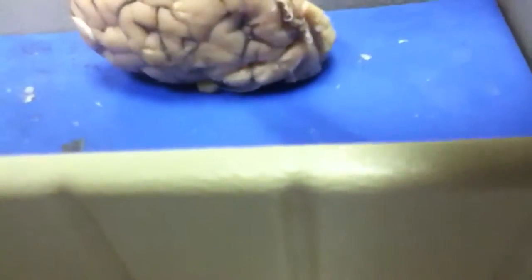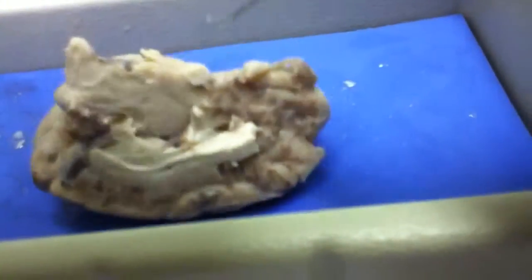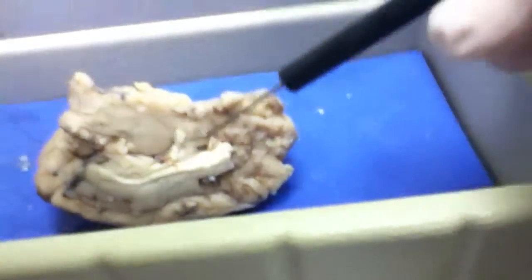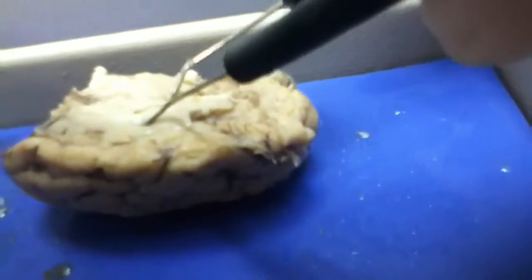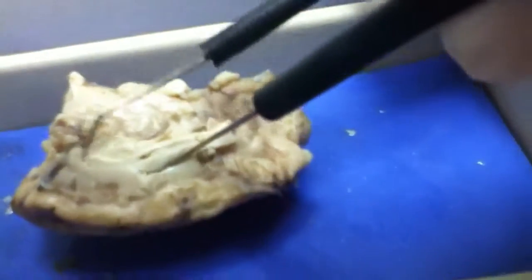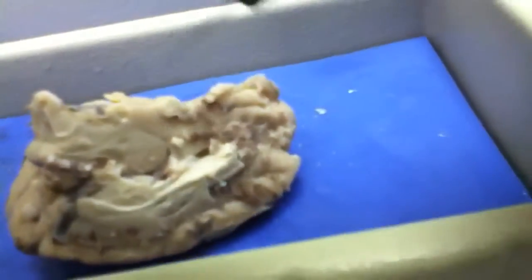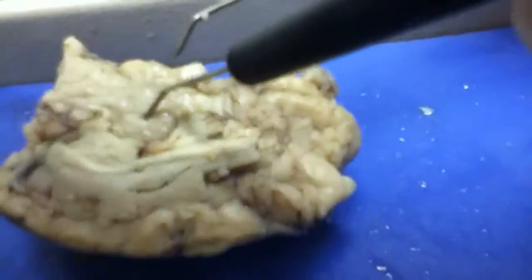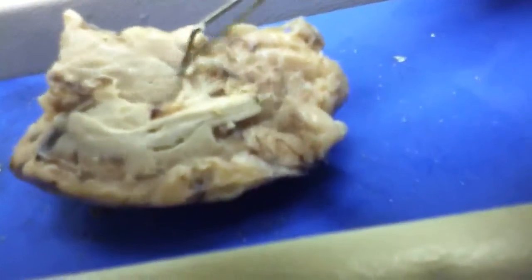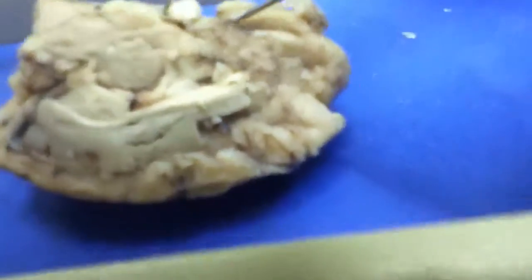That's what I cut in half when I cut the brain. The corpus callosum should be white — yeah, it's white. It's kind of wavy, a thicker membrane. It's right above the ventricle. The bulb underneath the corpus callosum is the thalamus. We'll get to that. You also have hard words like the gyrus, the sulcus, septum pellucidum. I love that optic nerve — that is so cool to see. And then the different ventricles.